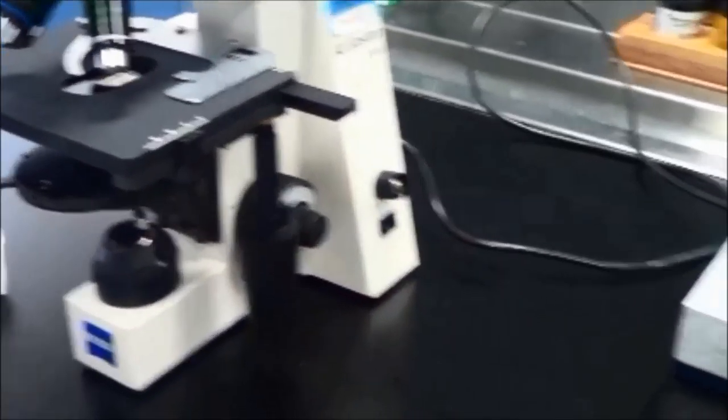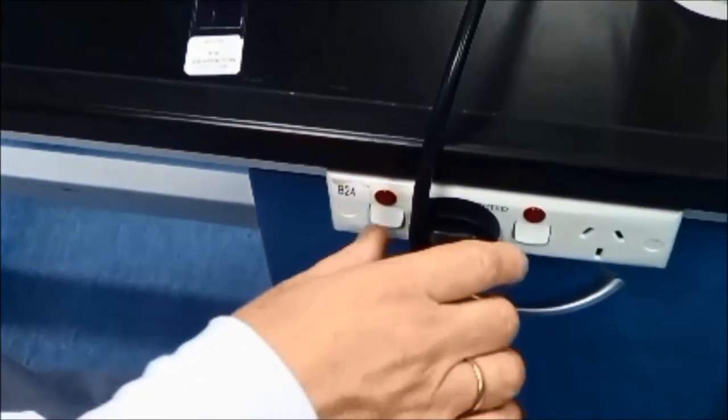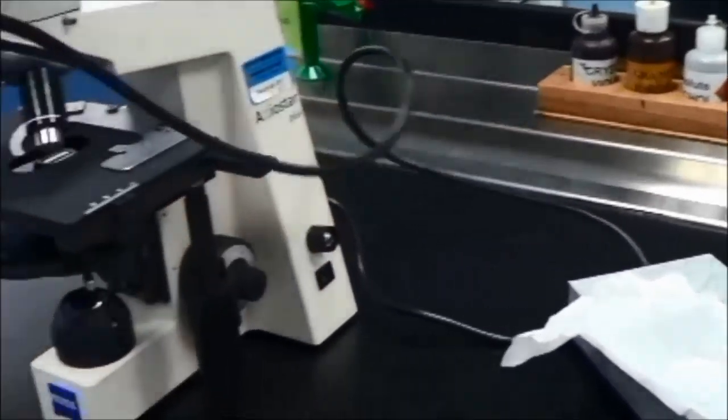Turn off the light, loosely wind the power cord around the microscope, replace the cover, and put the microscope carefully back into the cupboard.